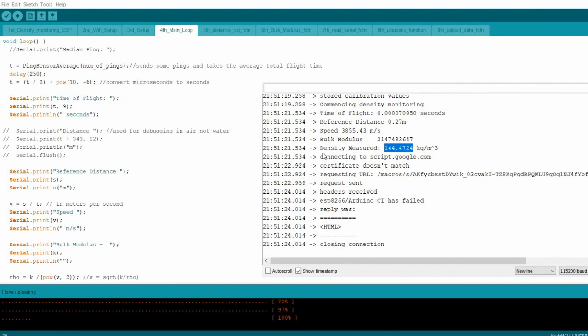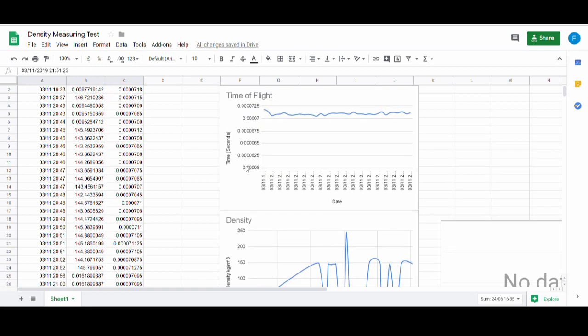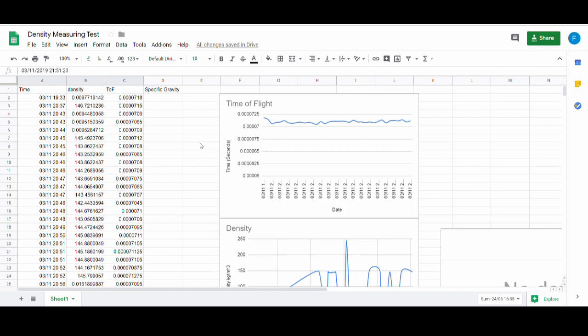On a positive note, though, the Google script which I'm using is working very well, and we're successfully uploading to the drive. This is uploading to a Google Docs document, which I will show you now. Okay, so here you can see what's been uploaded to the Google Docs so far. The majority of these values, bar the last two, which were highlighted at the bottom there, are all kind of garbage values. They were just what was being uploaded as I was testing it out.